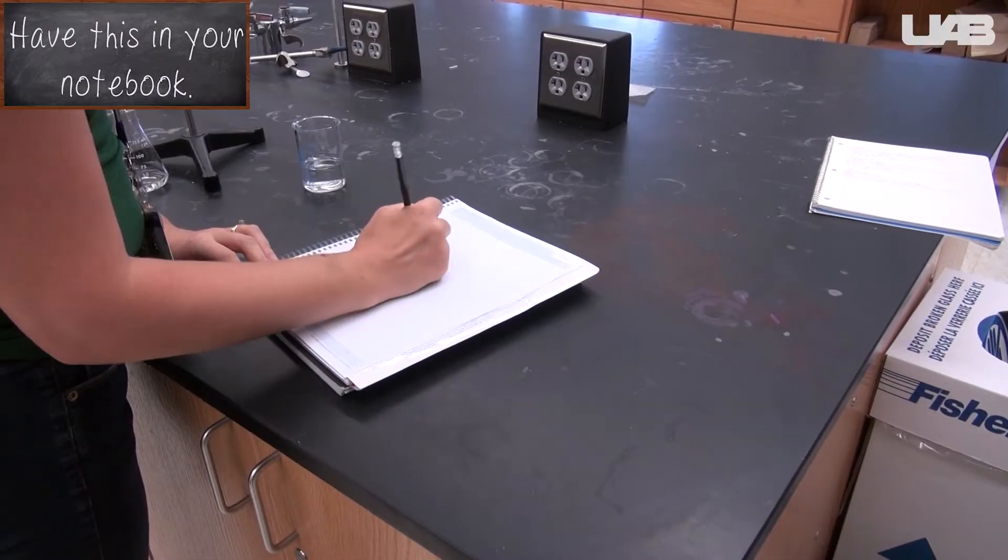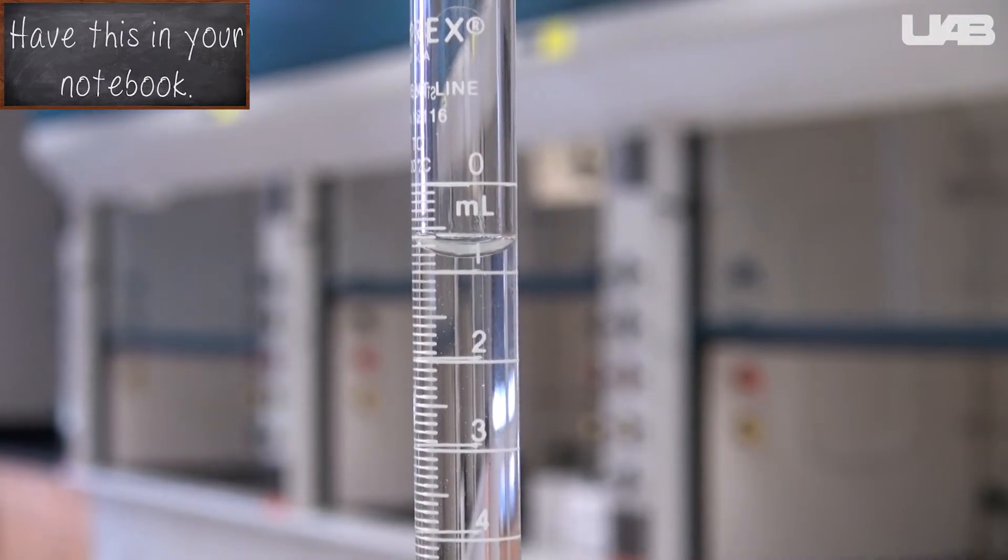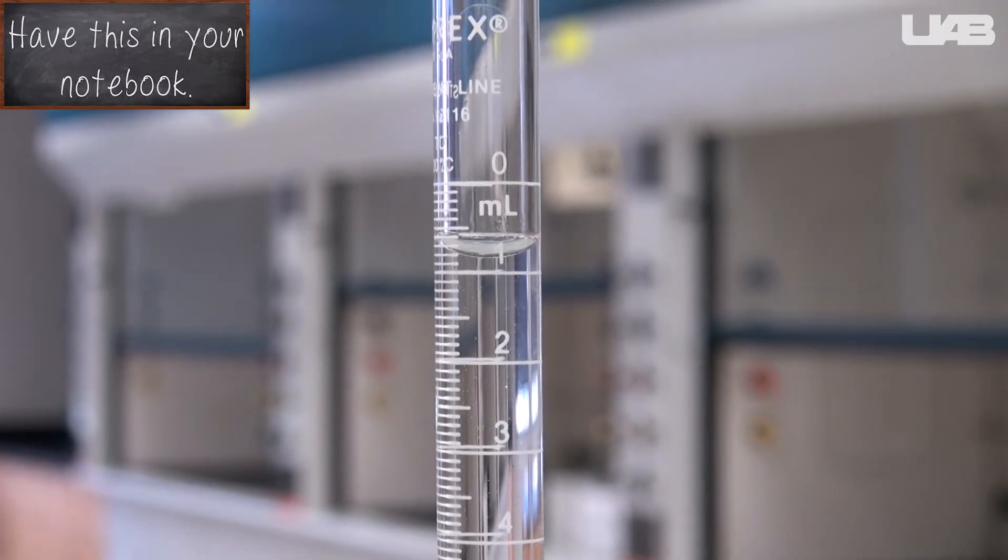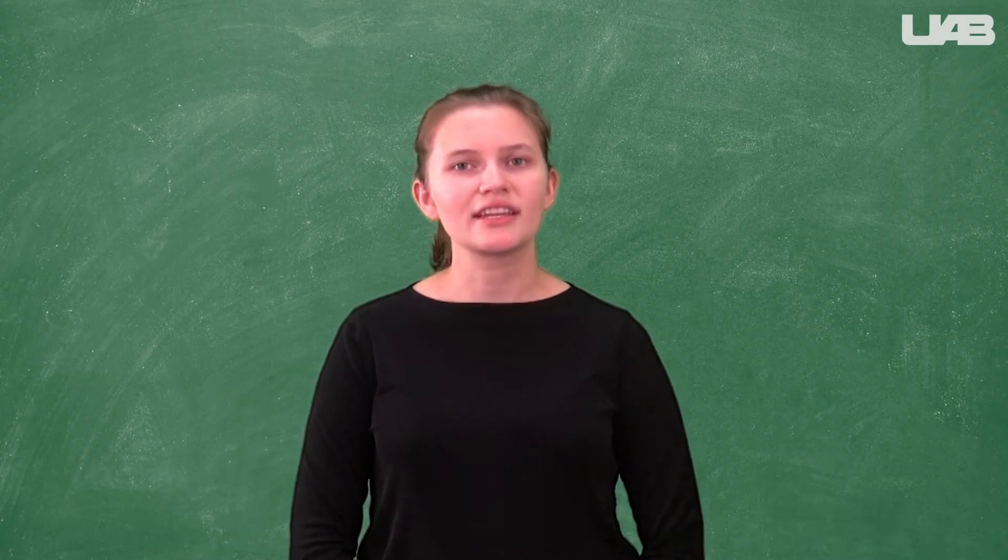Record the initial volume of sodium hydroxide. Remember to record to one degree of uncertainty past the graduations on the burette. Now you are ready to begin.